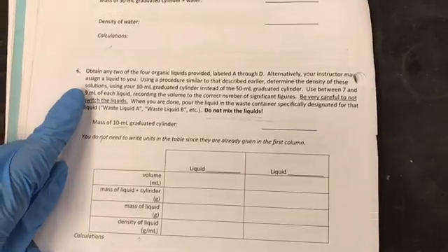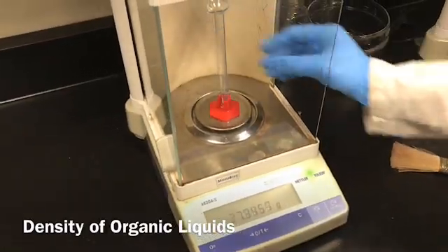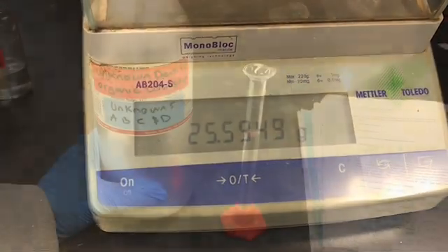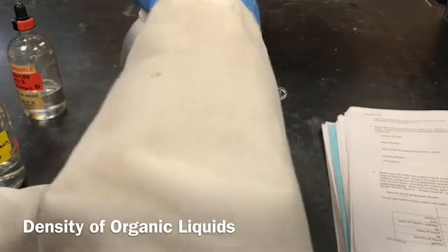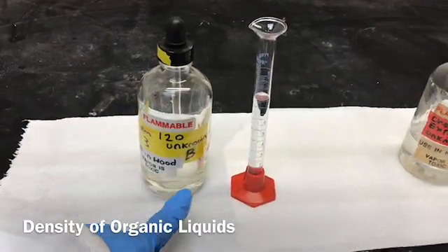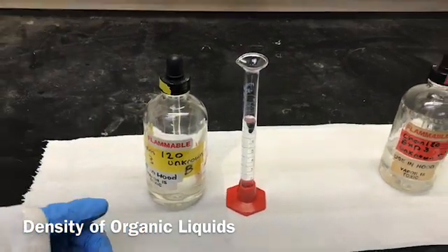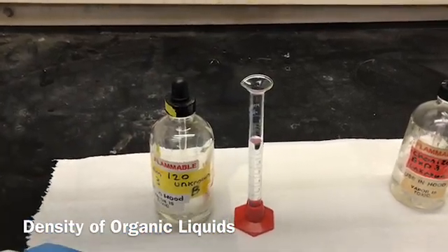So let's start now recording the measurements for density for the organic liquids. Mass of the 10 milliliter graduated cylinder. Now I'm going to discard the unknown liquid B into the waste container. Working with the unknown liquids B and D, which are organic, this is not good to inhale, and they are flammable liquids. So make sure that you are working in the hood when you are dealing with those liquids.